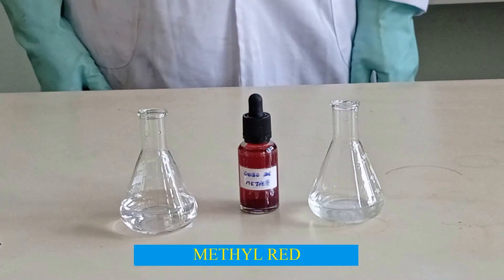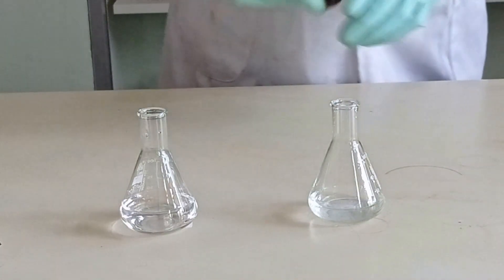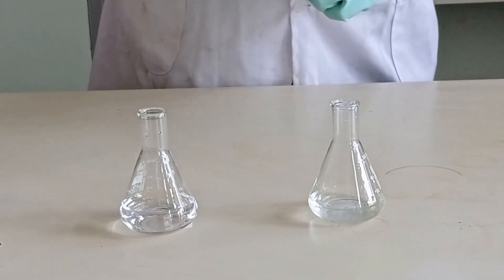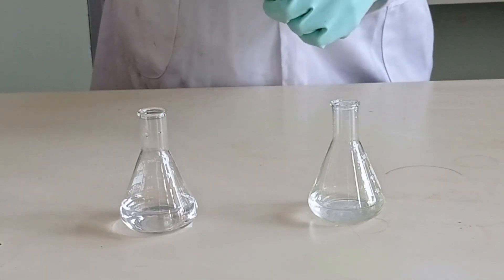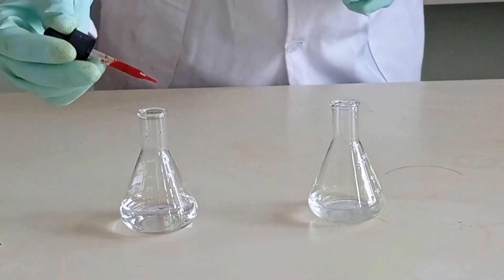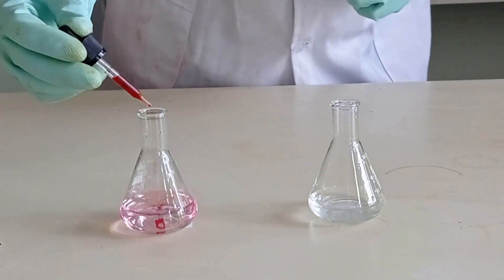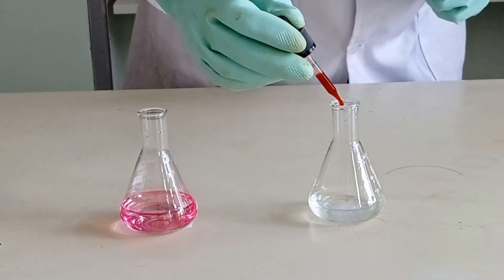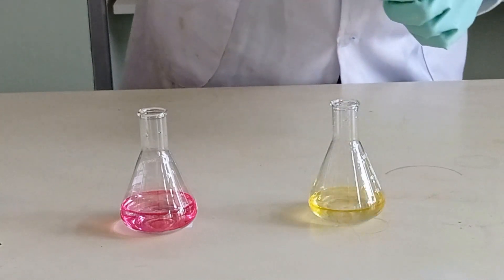This is methyl red. Methyl red in an acidic medium is red, and in a basic medium it is yellow.